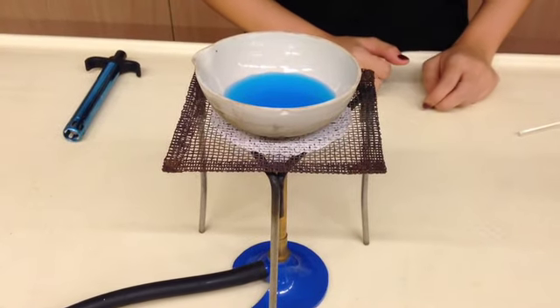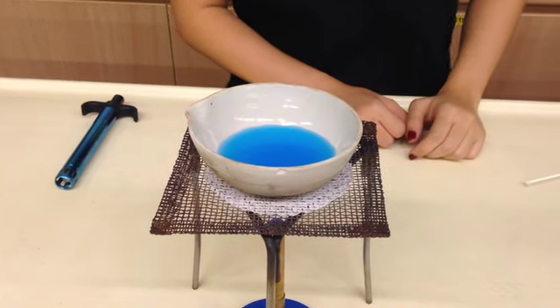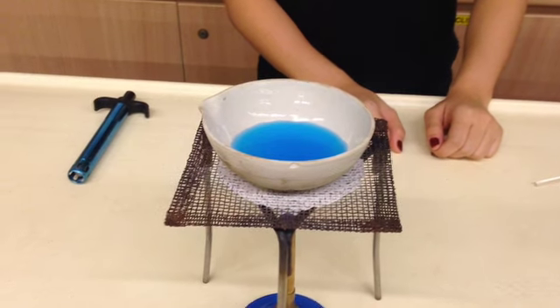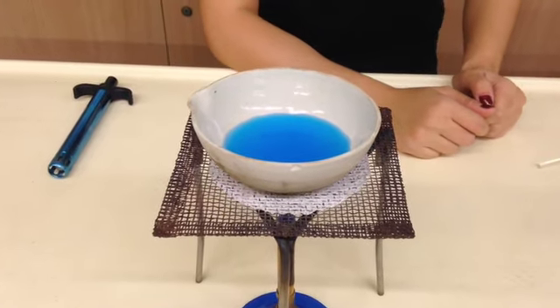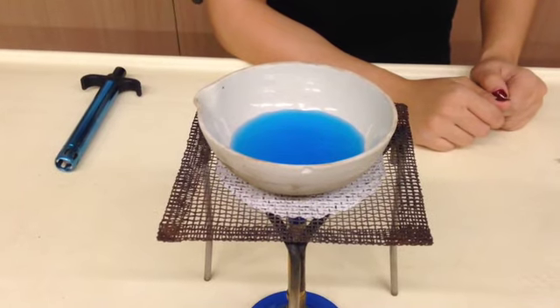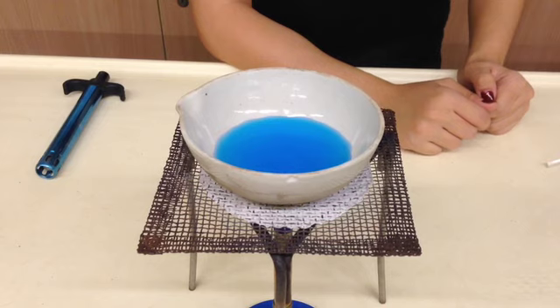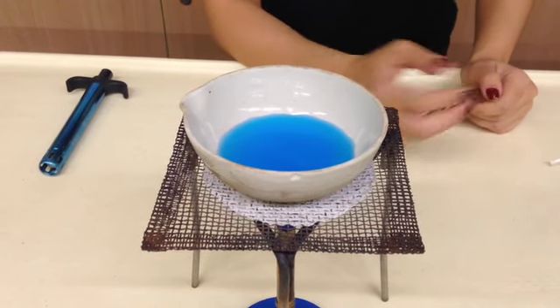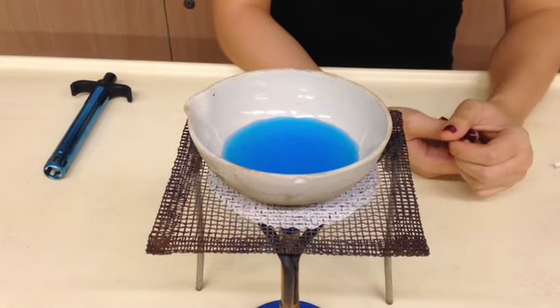At this point in time, you should start to see a little bit of bubbling. This indicates that boiling of the water is actually taking place. Remember that when we're talking about copper 2 sulfate solution or any solution in general, we are taking a salt and dissolving it in water. So the water, whenever we're heating, is the one that's going to be boiled away, not the copper 2 sulfate salt. When we boil the water away, we are going to do it in a very slow manner, so that whatever we have left will just be the copper 2 sulfate crystals.